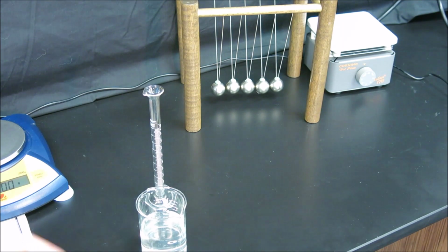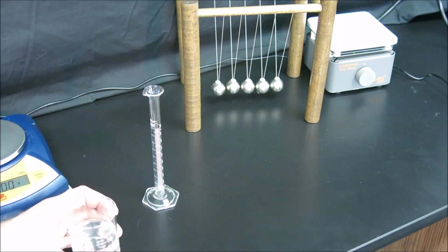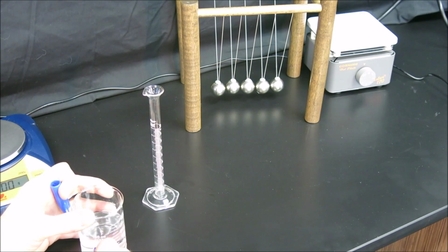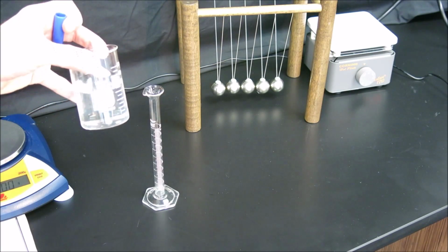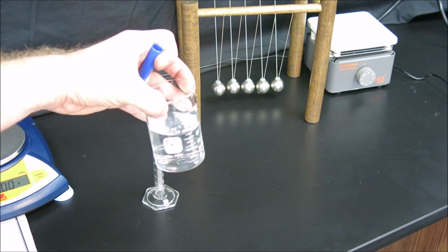It's important whenever we decant into a beaker to label it. I have labeled this beaker with iron 2+ ions, but I will make that darker here using a blue Sharpie. So we can see there that we have iron 2+ ions labeled on that beaker.